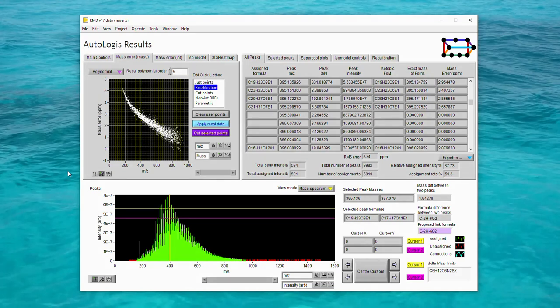The first recalibration option is conceptually the simplest, but it is likely to be used only rarely. In this method, you, the user, will choose exactly where to draw the recalibration line. On the mass error by mass plot, set this menu to recalibration mode, set the recalibration style to polynomial, and choose the cursor tool from the Graph Tools palette. Then you can add calibration points onto the graph simply by double-clicking in the place you wish to put them. Then to apply this recalibration line, you'd simply click the Apply Recal Data button.